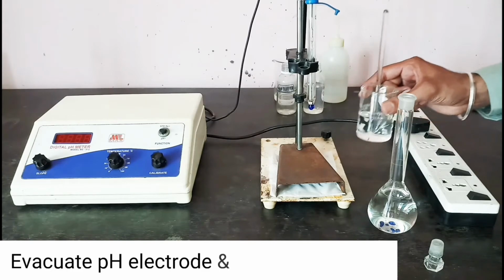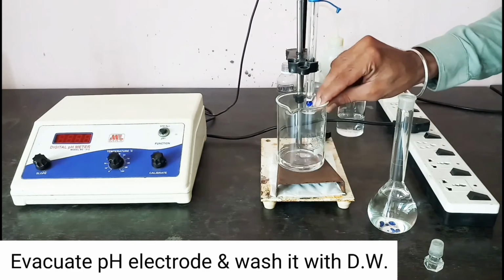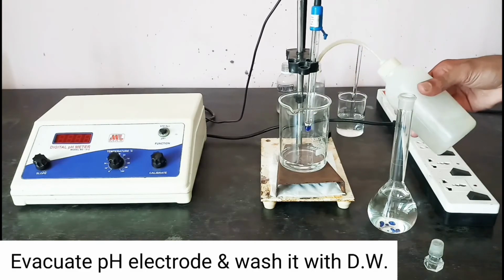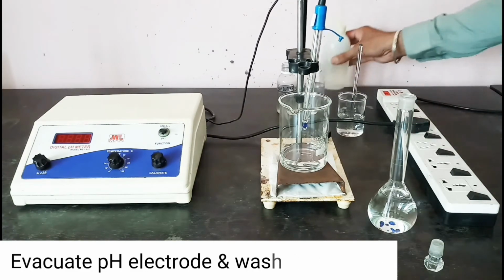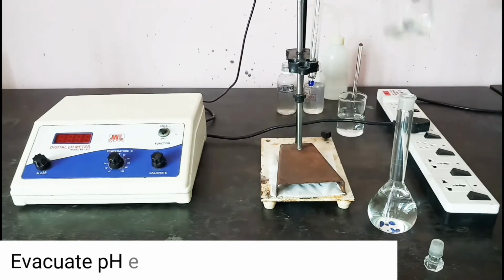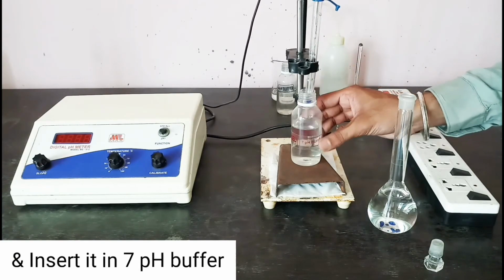Evacuate the pH electrode and wash it with distilled water, and insert it in 7 pH buffer.